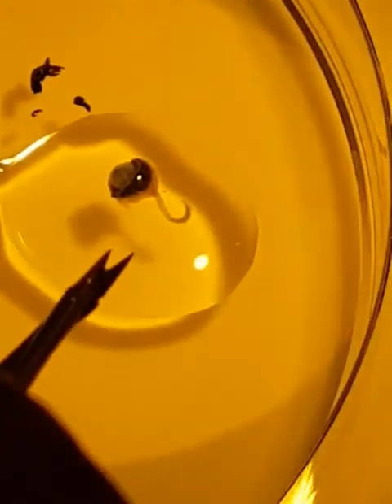The crystalline, the lens, is out. I'm not going to put it in now because it's going to help us as a mold. Another thing we don't need anymore is the optic nerve. If you need to do RPE flat mount, you need to clean it much better — but that's not necessary here since you're just using the retina.